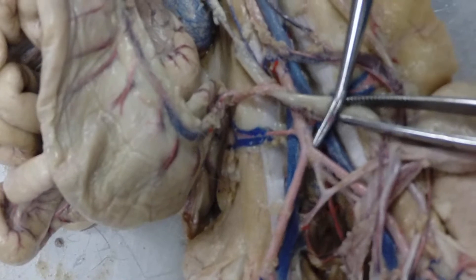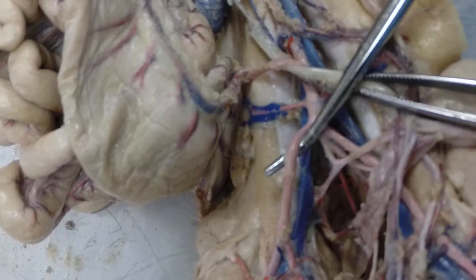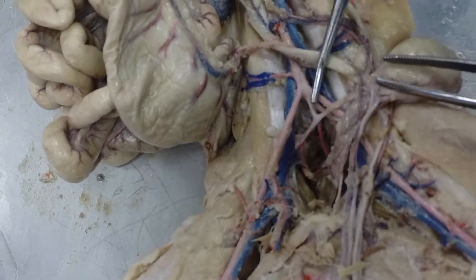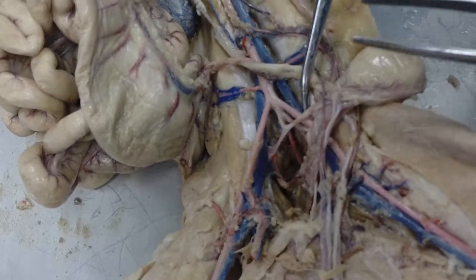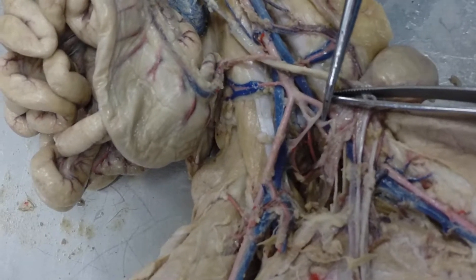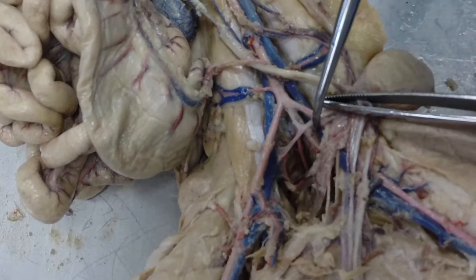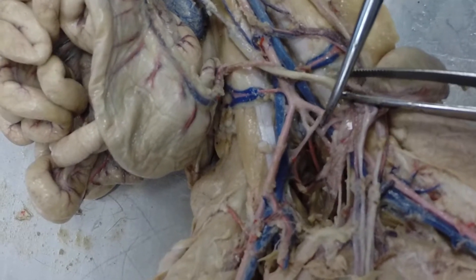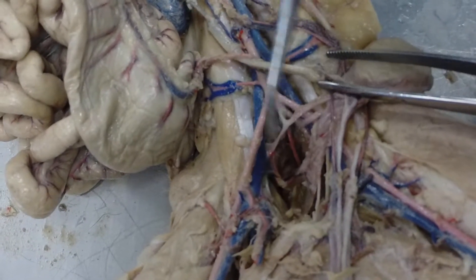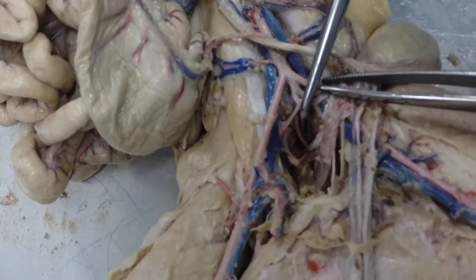Now our descending abdominal aorta is going to branch twice. The first branches are called the external iliac arteries — this would be a right external iliac artery and a left external iliac artery. And then if you look really closely in here, you can see a second set of branches — this would be the internal iliac artery. And then there's this little artery that goes straight down, which is the caudal artery.